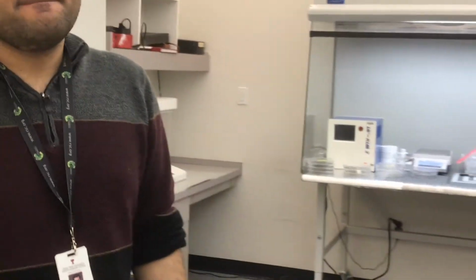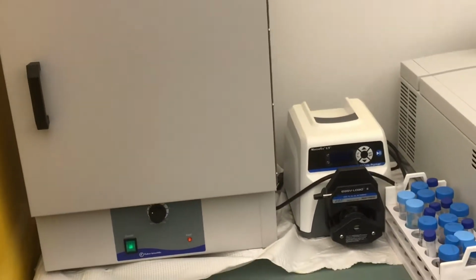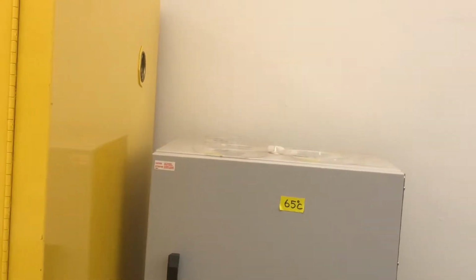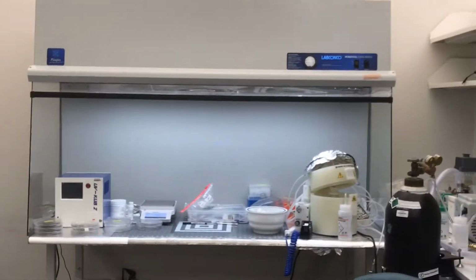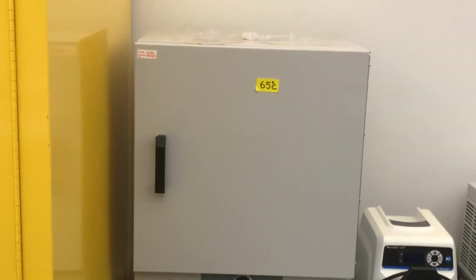Okay. So again, after 2 hours, now it is, for example, 11:15. You will come at 1:15 and take this out, and you are going to put them over there. Yes. Okay. Now, can you explain what this heating in the oven is doing to the chip?